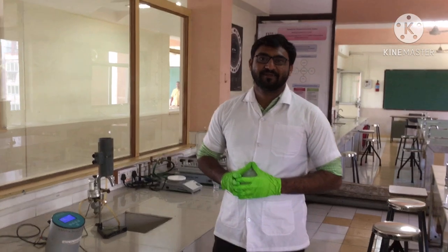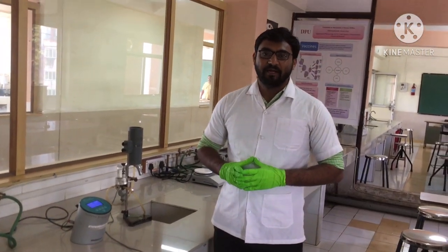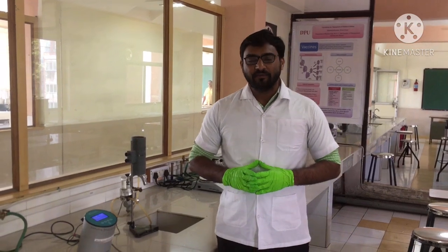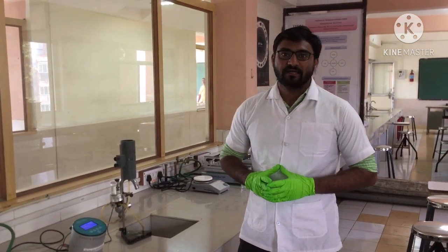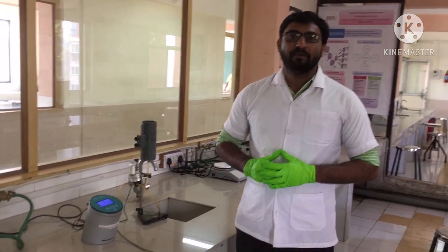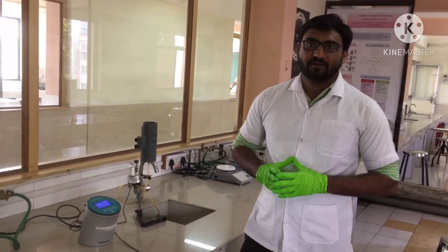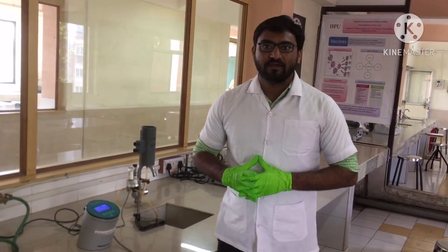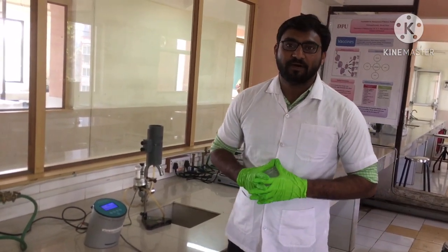This is Pradeep Kodi, working as an assistant professor in the department of Pharmacology from Dr. D.Y. Patil Institute of Pharmaceutical Sciences and Research in Pune, with my colleague Manish Kokani, who is doing his master in pharmacy from the same college from the Pharmacology department.